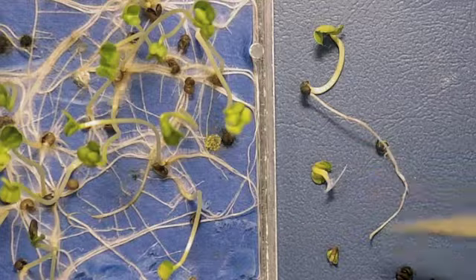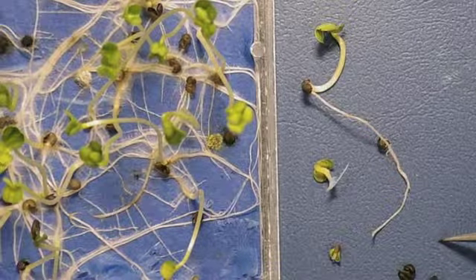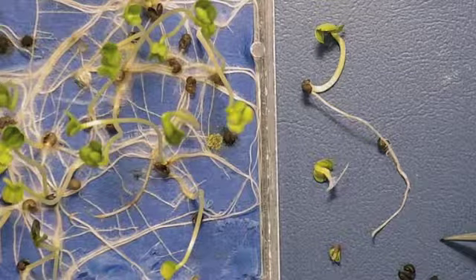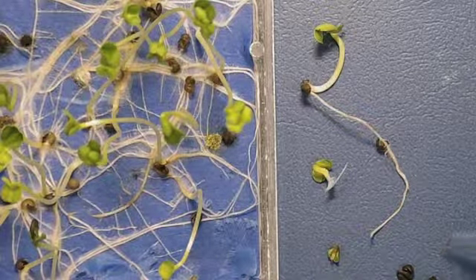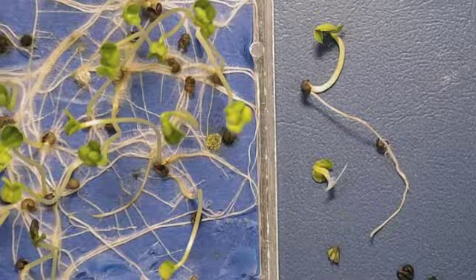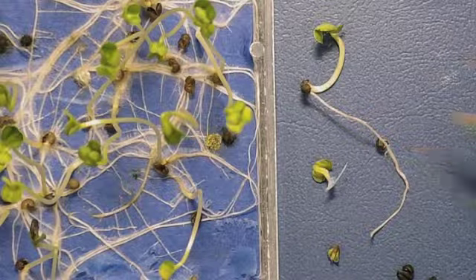So this shows you that even under optimum conditions, if there's an issue with the seed, particularly if it's very, very poor, we can pick up some of the detriments with the seed and start to get some good ideas on, especially with some of the symptoms such as the dead seed and the abnormals, what's actually causing this problem.